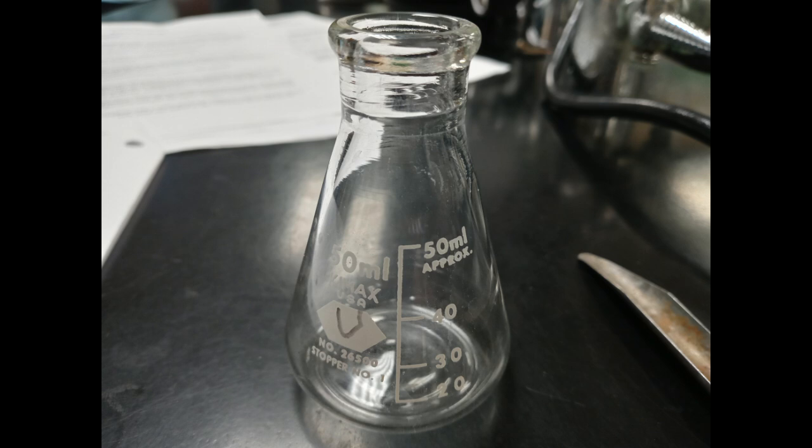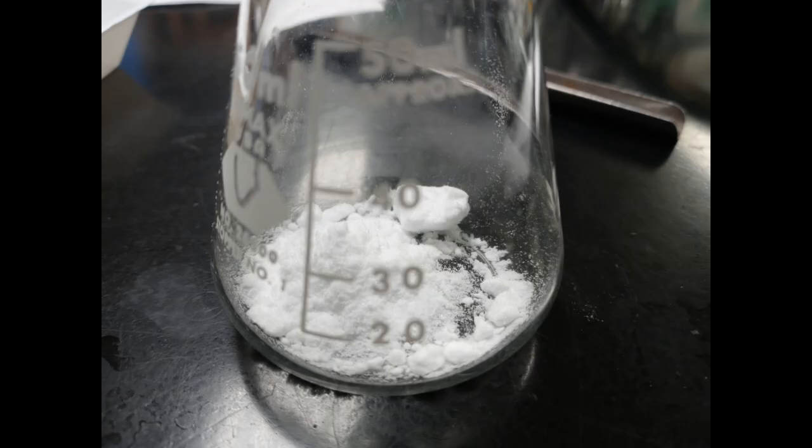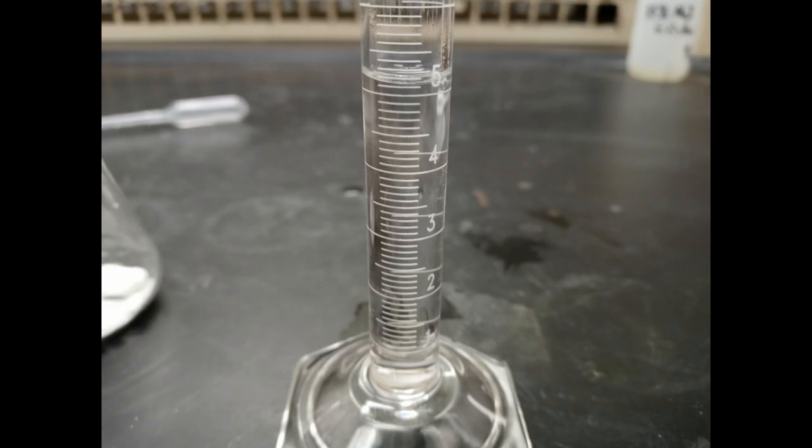Today, I will be making aspirin. First, I start with 1.9947 grams of salicylic acid, measured out in a weigh boat, and then added to a 50 milliliter flask.